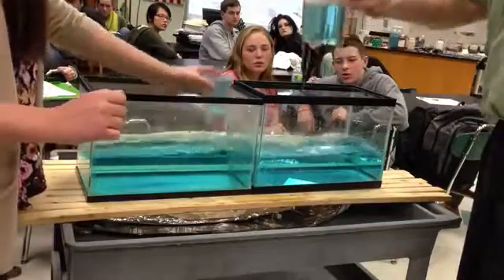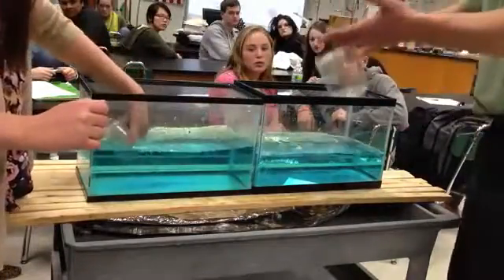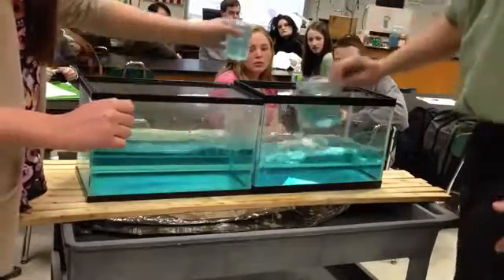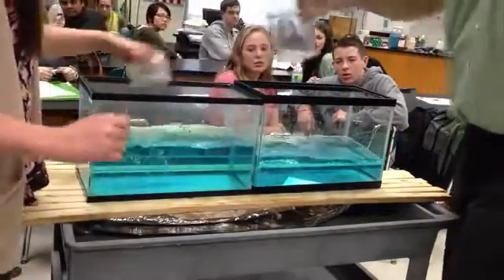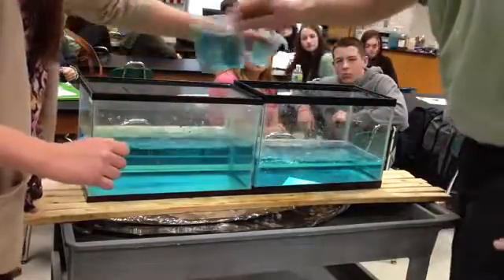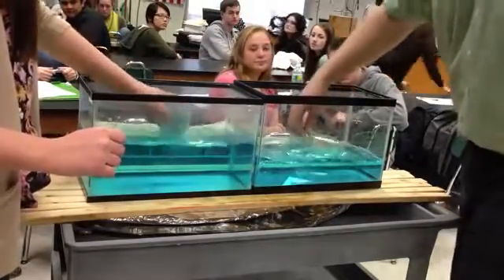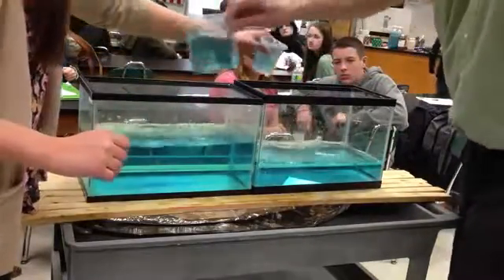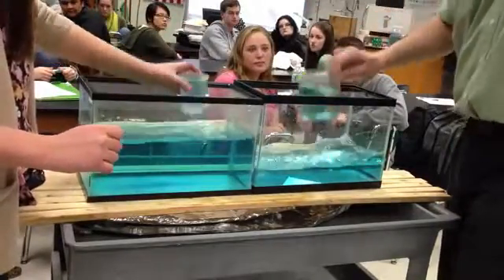Keep going. Nothing stops. Why would I stop? I've got reactants that are combining. So no, you thought equilibrium is when the reactants and products are equal. That is not the case. But you know what? Most people think that. It's the biggest mistake. We haven't reached equilibrium yet. Please tell me when you think we have. I think you're onto something.